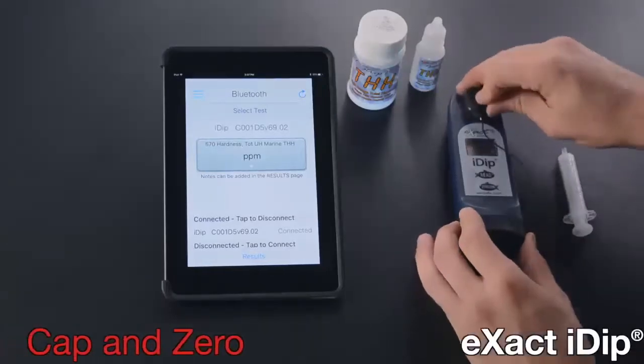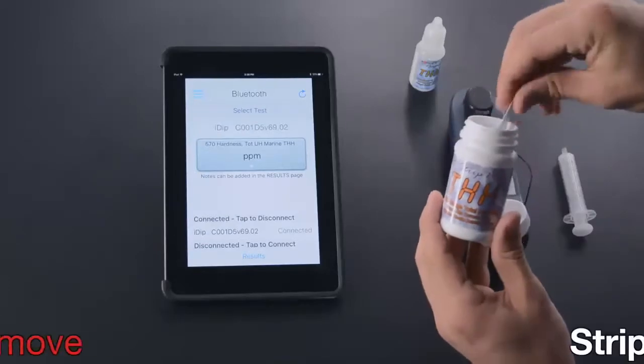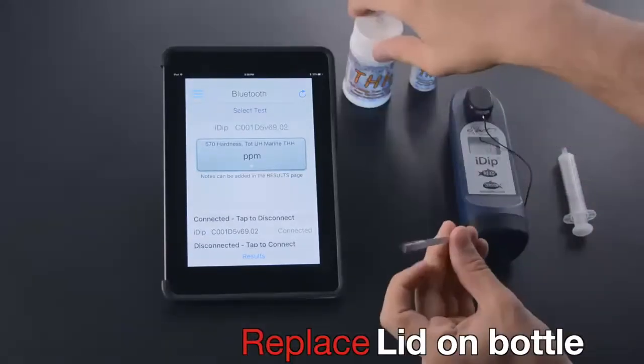Cap and zero eXact iDip. Remove strip, replace lid on bottle.